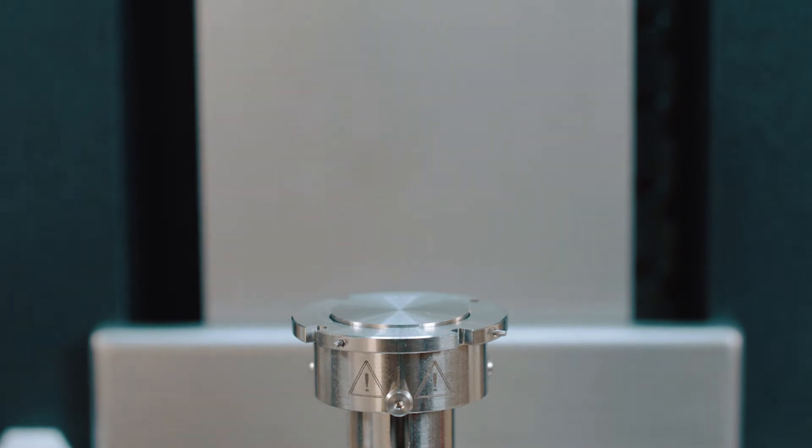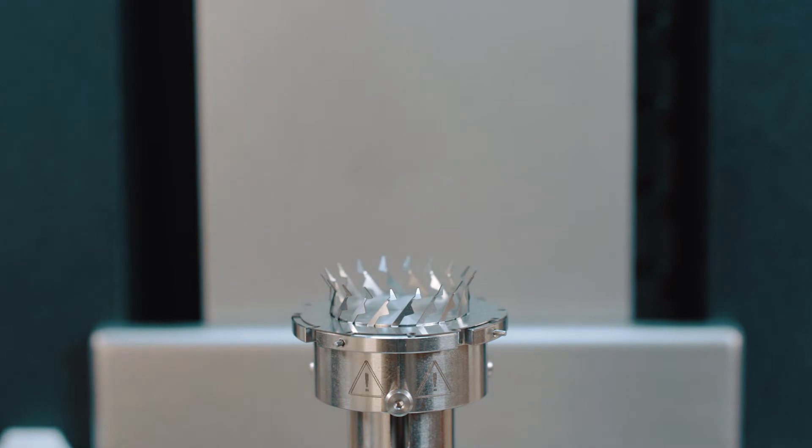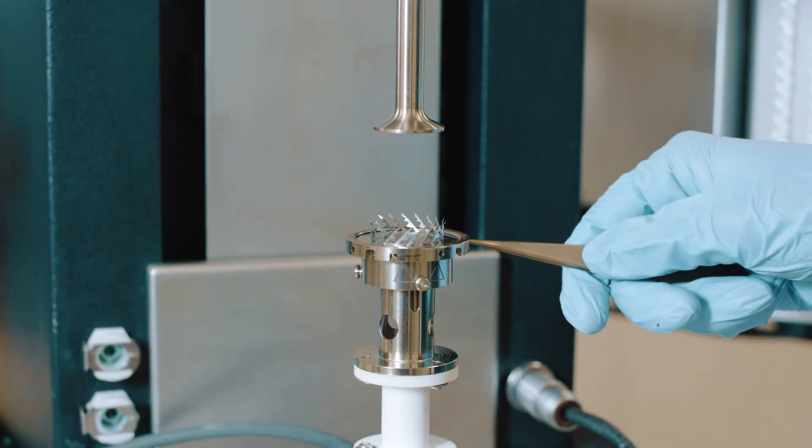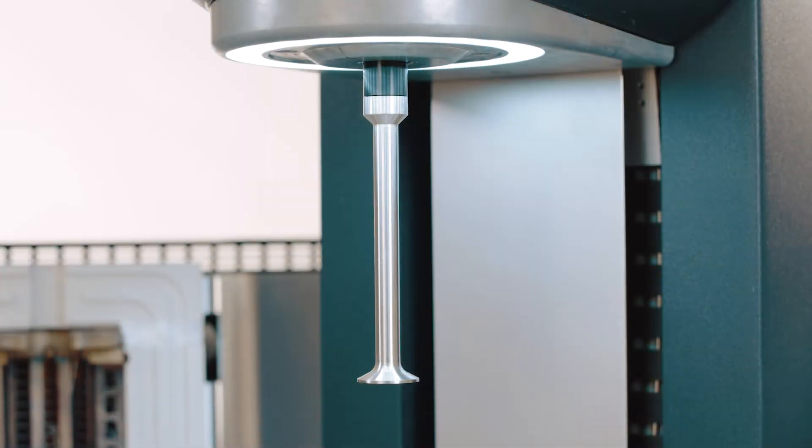The setup consists of the pedestal, disposable trimmer, locking ring, and 25 millimeter diameter geometry.